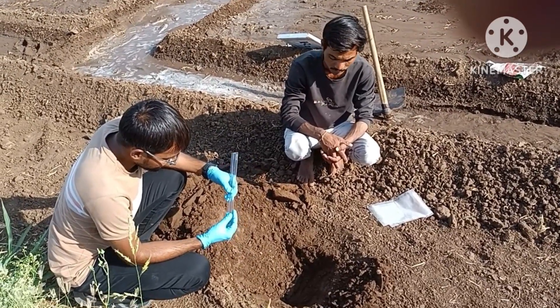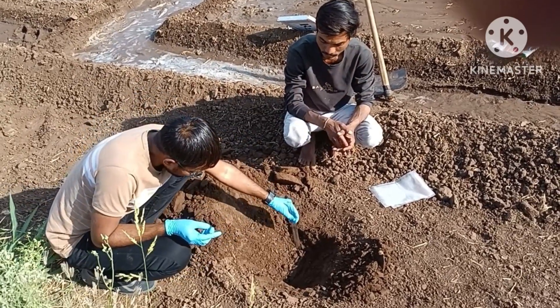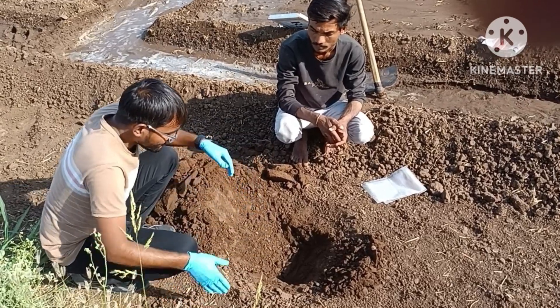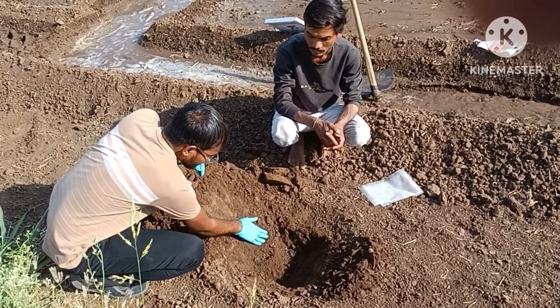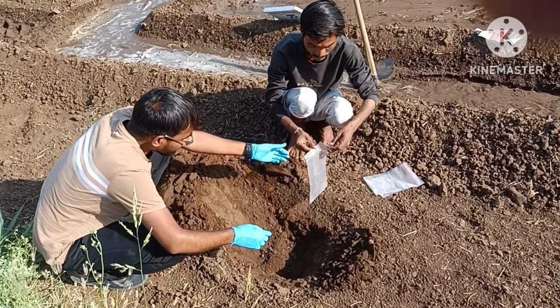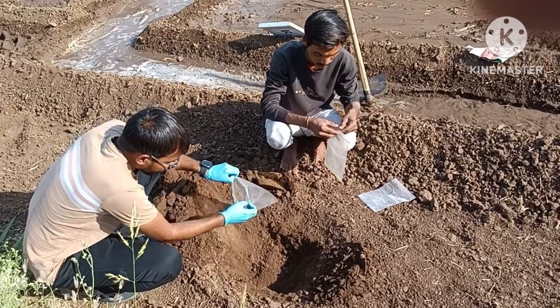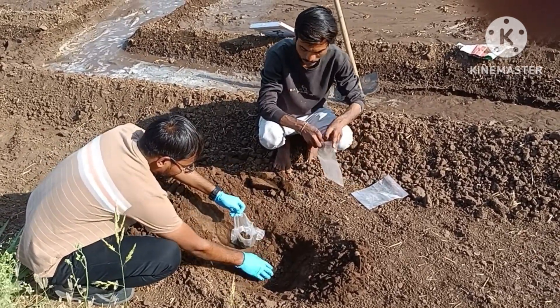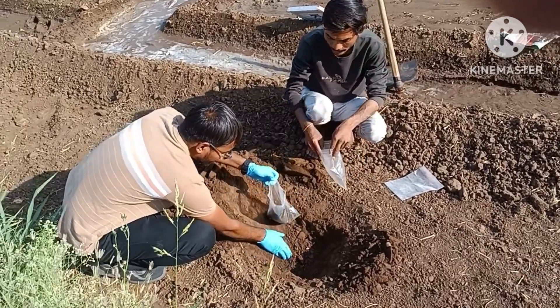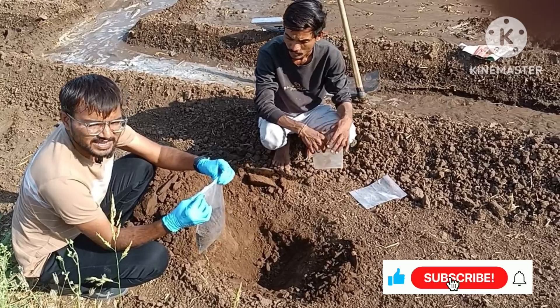Here I am taking out 15 centimeter — as you can see this is the 15 centimeter — then taking out soil like this, and removing all the grasses and plant parts and filling in the container. So this is one place done.